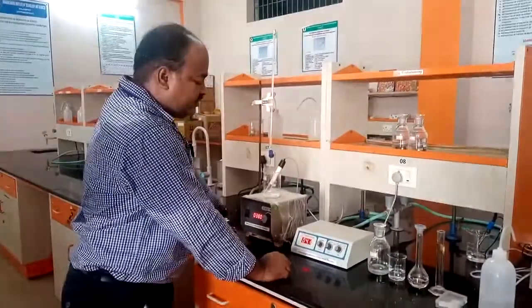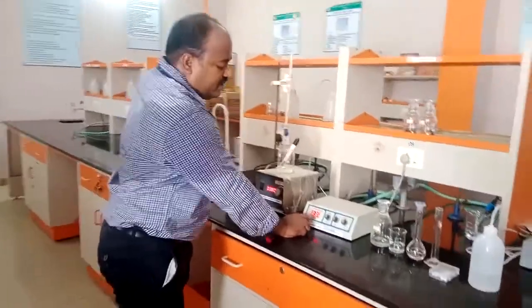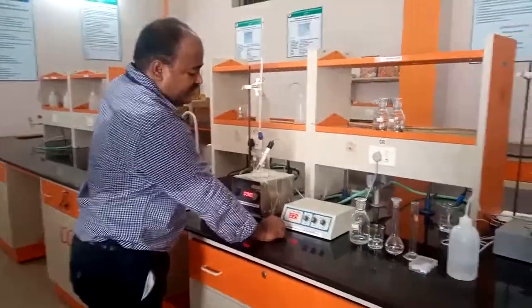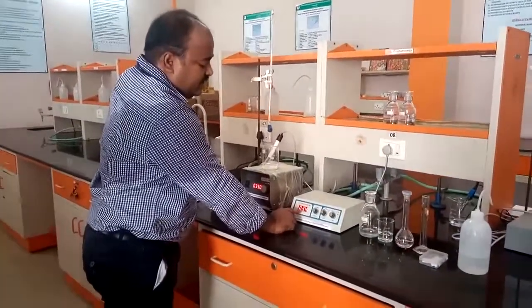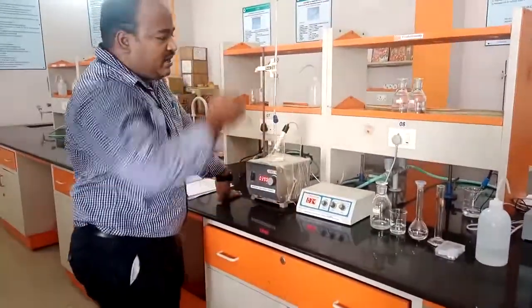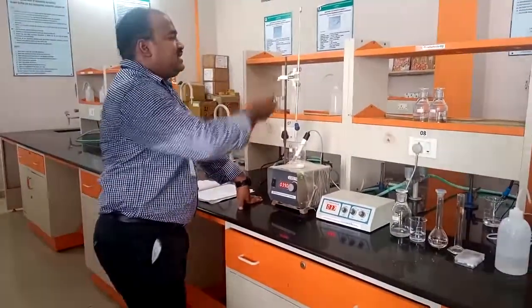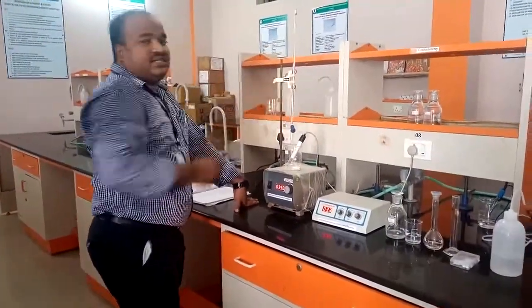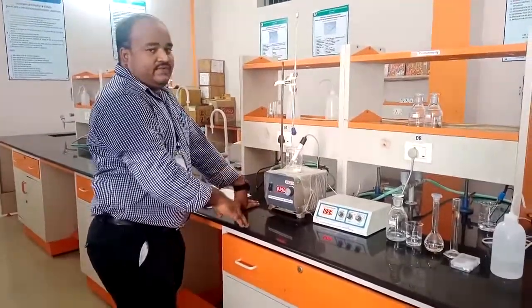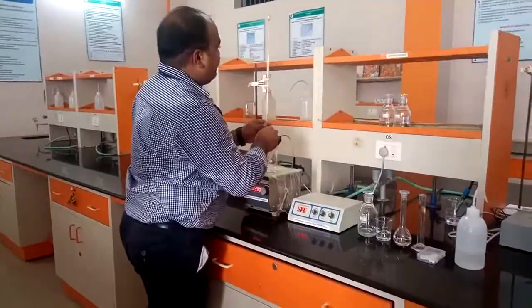We need to wait another 2 to 3 minutes until it becomes constant. It is not constant yet. So now it is constant. It is 3.4. Now the conductivity is decreasing. Why? Because the hydrochloric acid is being neutralized by NaOH, so the conductivity is decreasing. Still we will add another 0.5 ml.